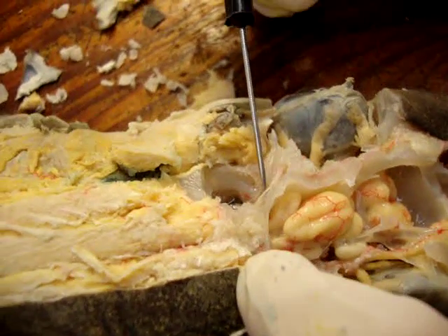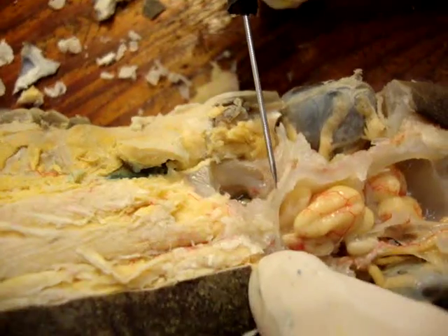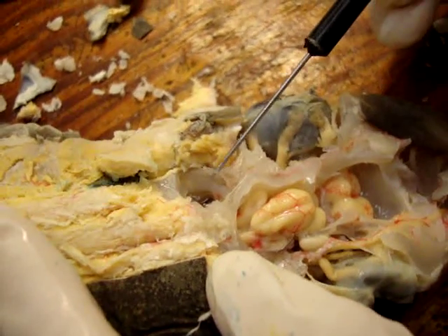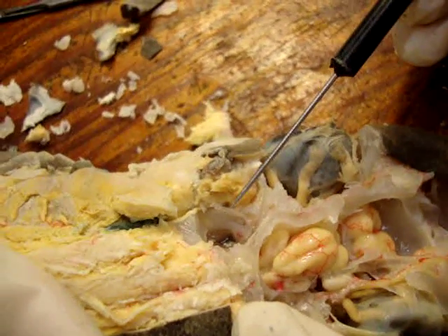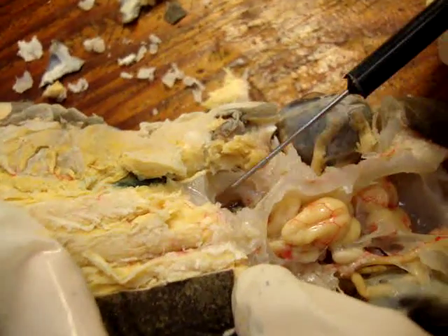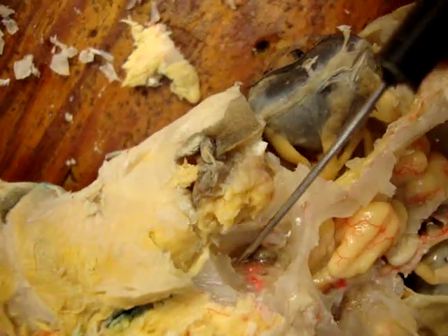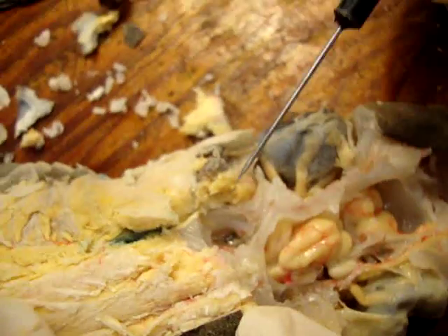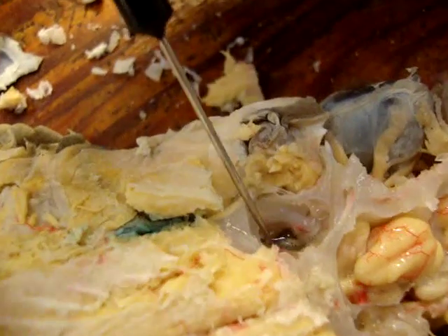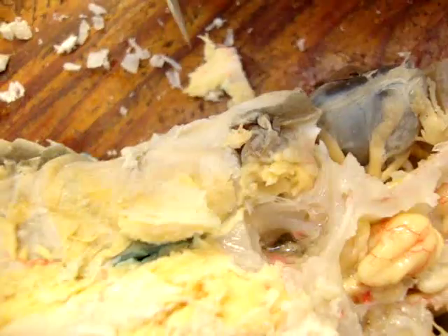Here is the semicircular canal. There is another one here, which got cut off. And then there's one in here that's kind of hard to see. The sacculus is here where the sand is — all that gray stuff is the sand.